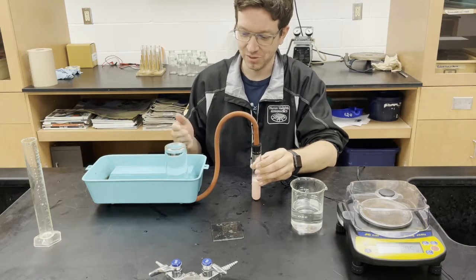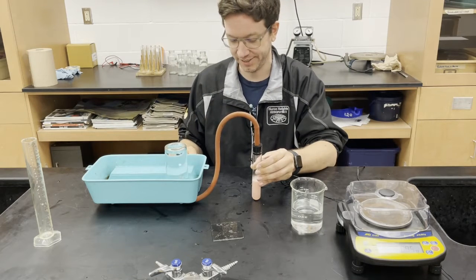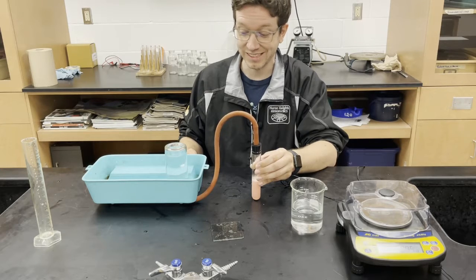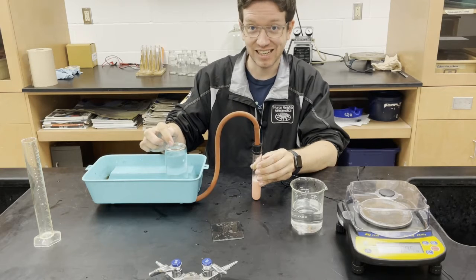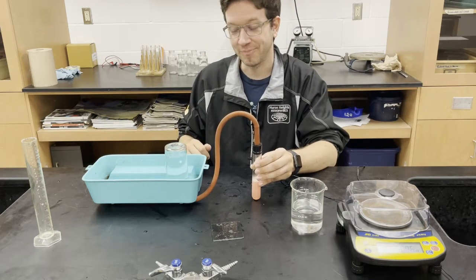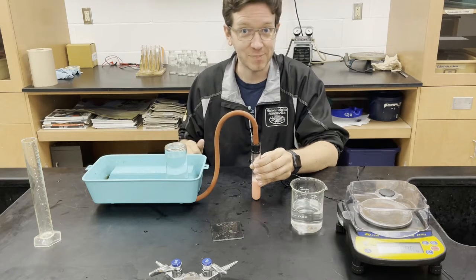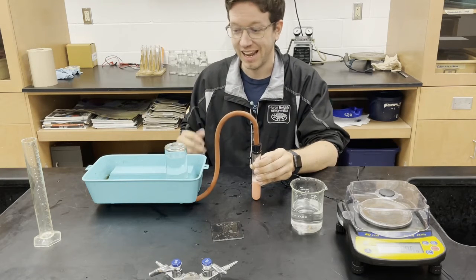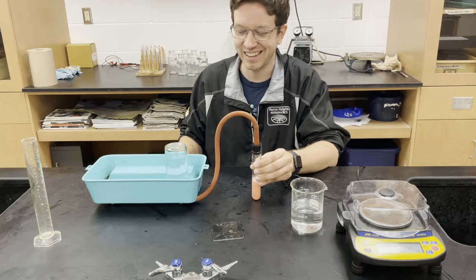The reaction takes a few minutes, so we'll let all the gas gather inside of our glass jar. When the bubbles stop, we're good. Now one thing to note when you're doing these calculations is you are collecting gas over water. So the gas inside this jar is not all carbon dioxide — there is going to be some water vapor. You'll have to look up the partial pressure for water vapor inside this jar based on the temperature in the room. The temperature in the room is currently about 22 degrees Celsius. The pressure in the room — let's go with standard pressure, 101.3 kPa — that'll be good enough for our lab.